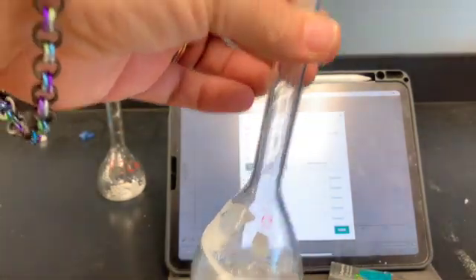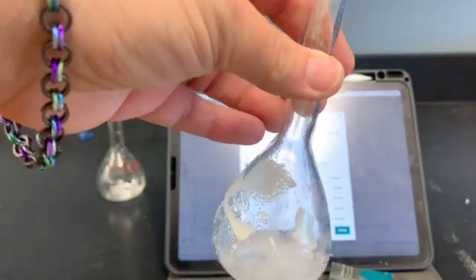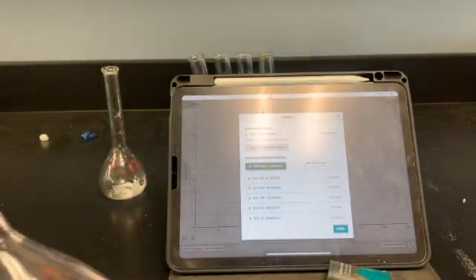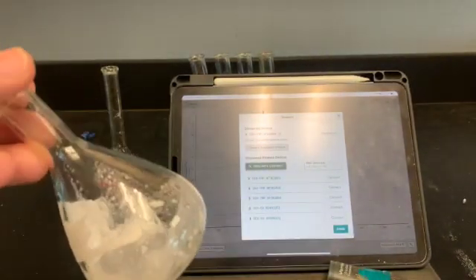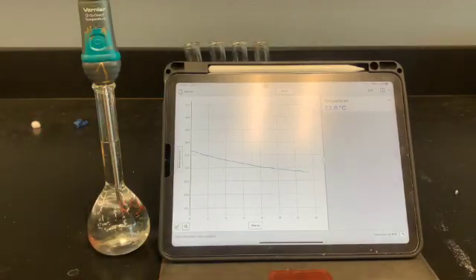So I'm going to start, and I just want to see, okay, it doesn't look like it's quite dissolving, so I'll add some more in there. And you keep repeating this process until you get to 100 milliliters. And then you'll stick your temperature probe in there and find out, is there a change of energy? So here's an example one. I've made one of my solutions. I set the temperature probe in there, and I'm reading what it says. Okay, and that's why we want the temperature probe with that part of the step.